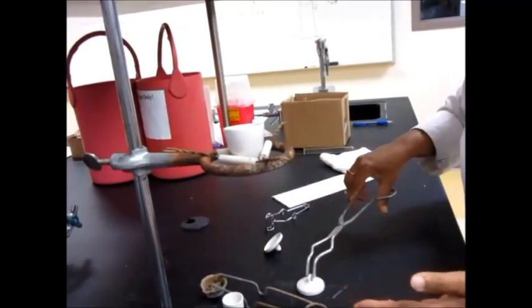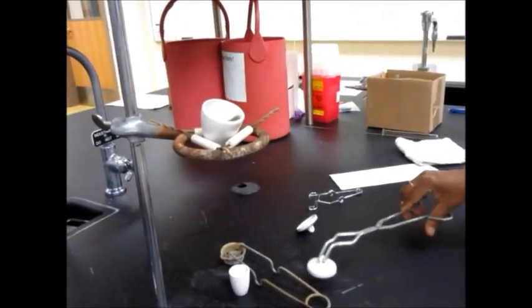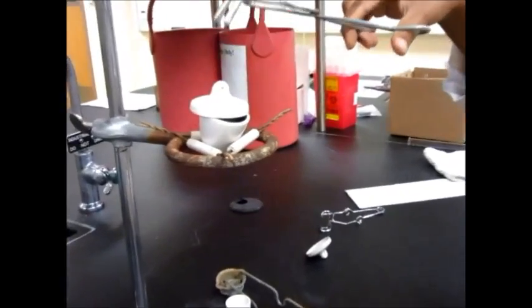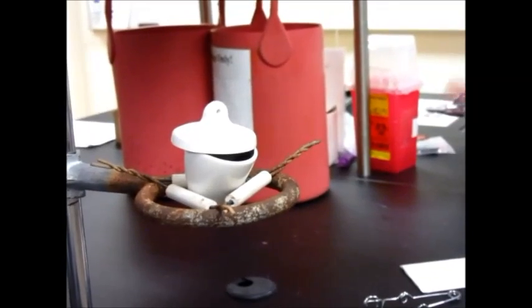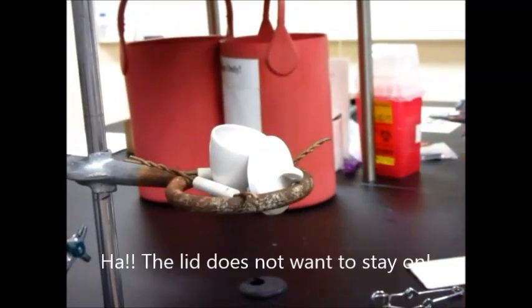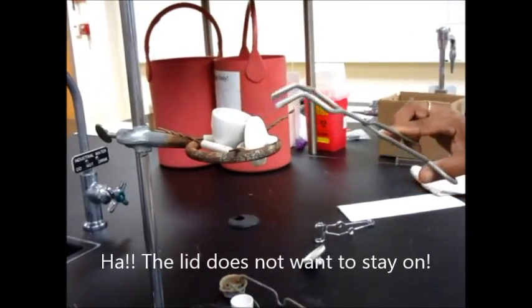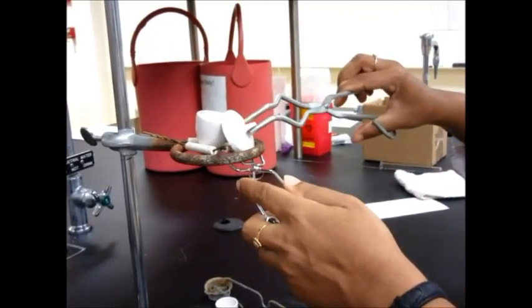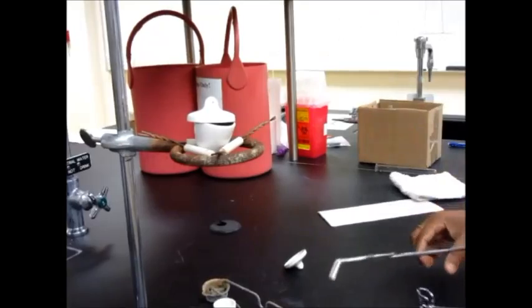I'm going to remove this for now and I think I need to tilt this just a little bit. And then when I place my lid, it should be all good. Be careful. This is a very sensitive thing and so many lids break because of this reason, as you can see it's happening right now also. So be very careful and place the lid carefully right there. I think I'm good now.